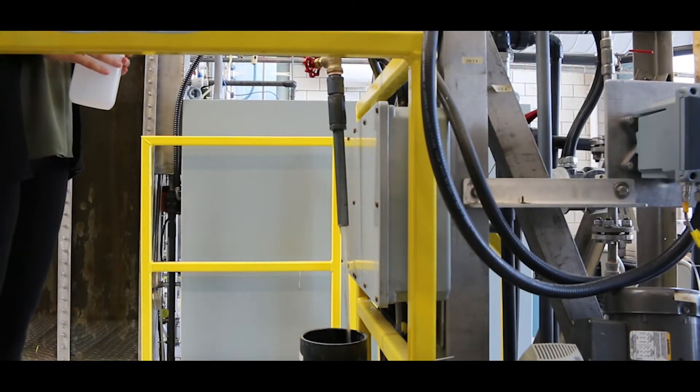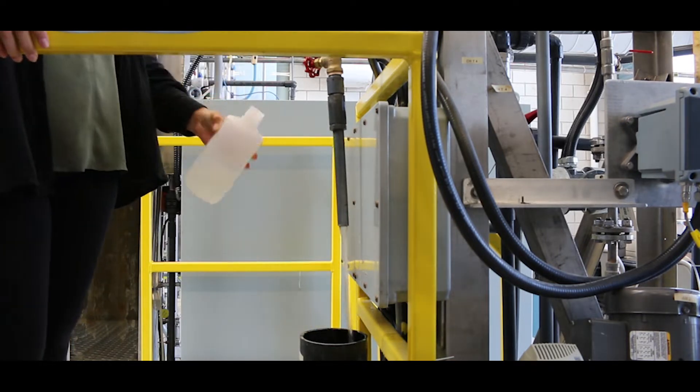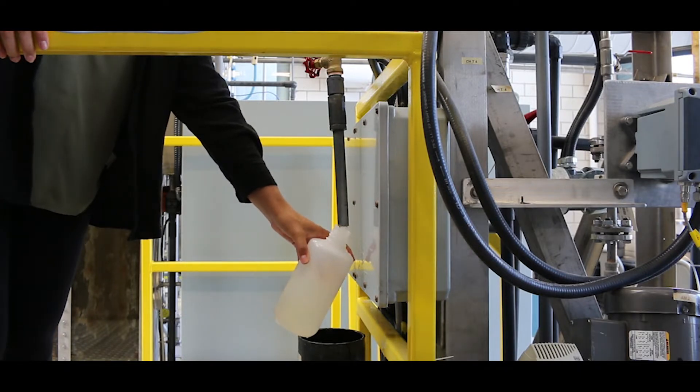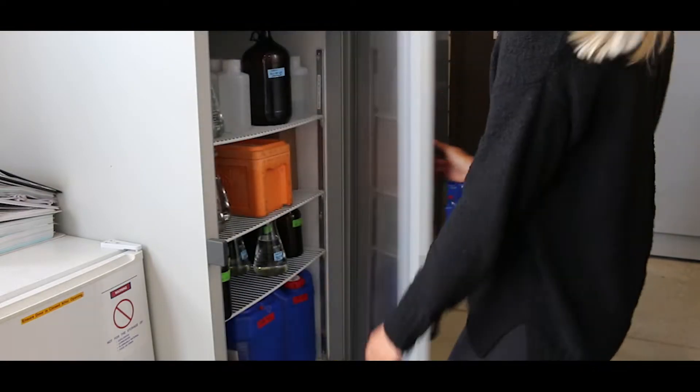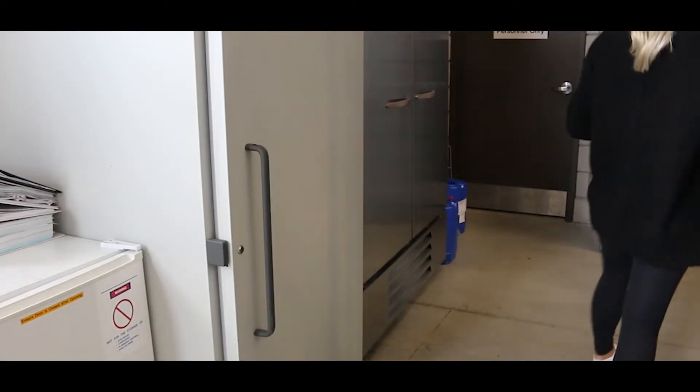Collect your sample in clean glass or plastic bottles and analyze as soon as possible for best results. To preserve samples for later analysis, fill the bottle completely, tighten the cap, and refrigerate for up to 48 hours. Let the sample warm up to room temperature before analysis.